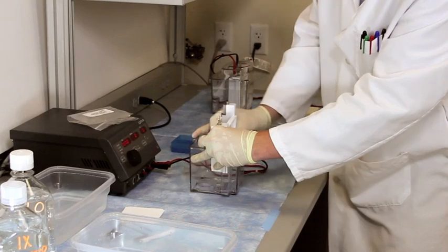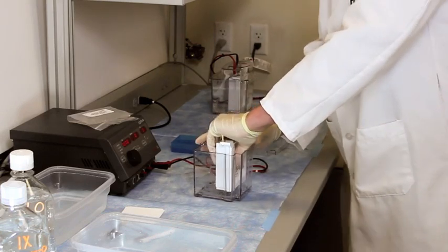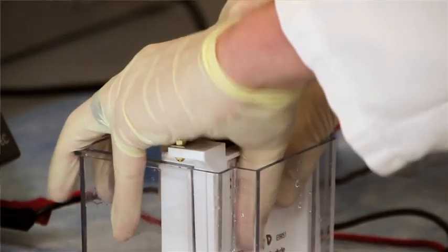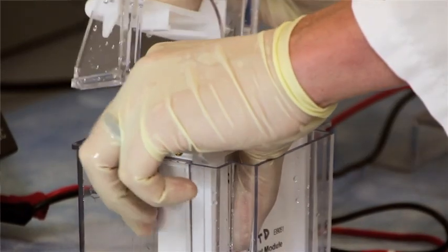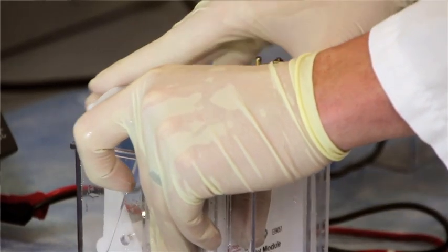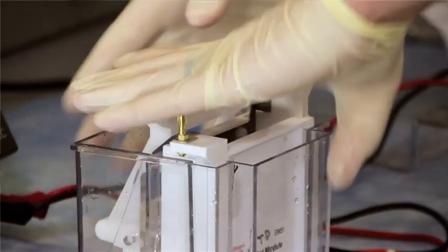And now what we want to do is keep a tight grip on this blot module, push it all the way down into the tank, and then put our clamp in and clamp that shut.